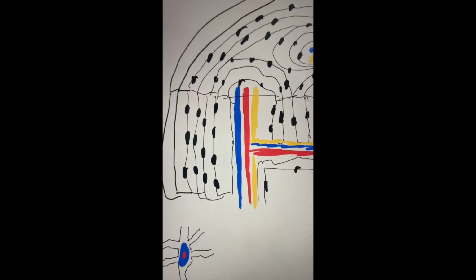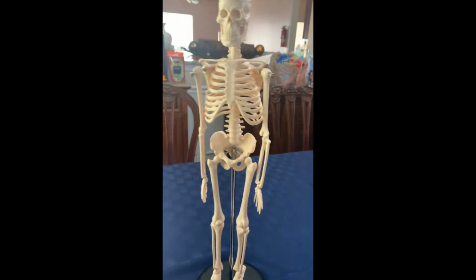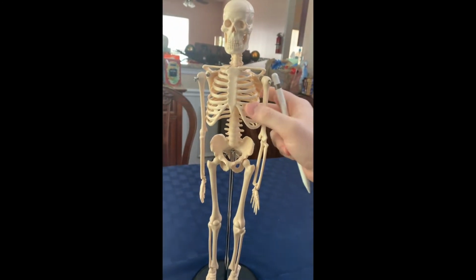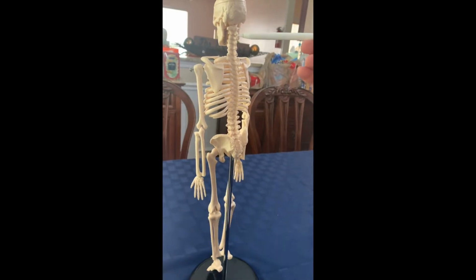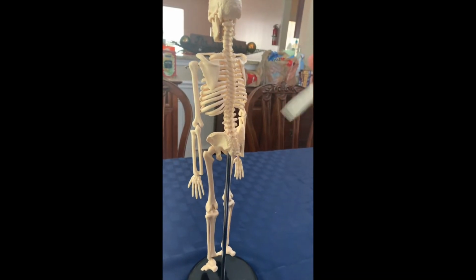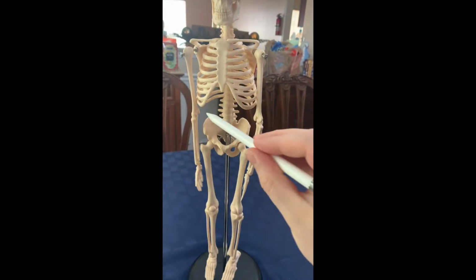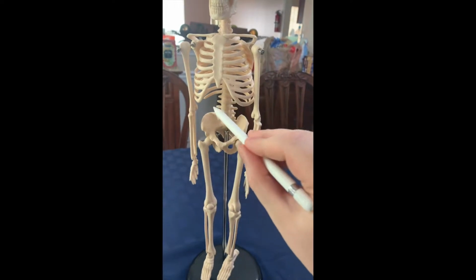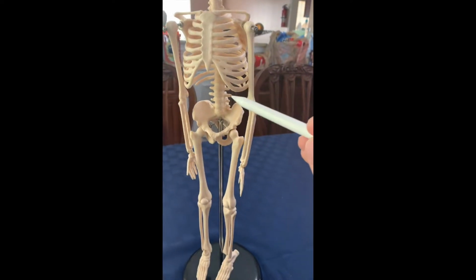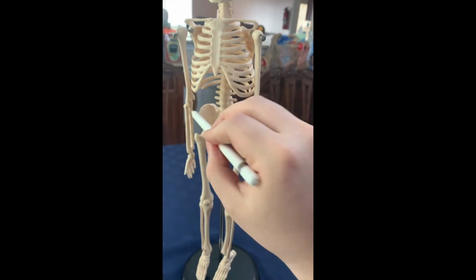All right. And moving on to my favorite friend here. So first one we'll look at the cervical vertebrae, which is back here. He's got 7 cervical vertebrae. His diaphragm will lie in the ribs down here, this area. The external abdominal oblique muscle will usually be on the side here, on either side.